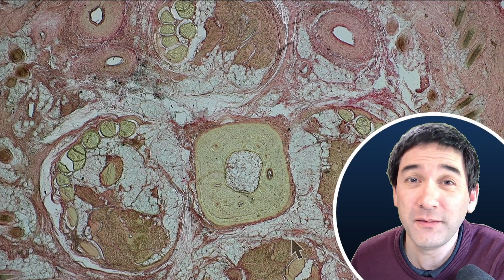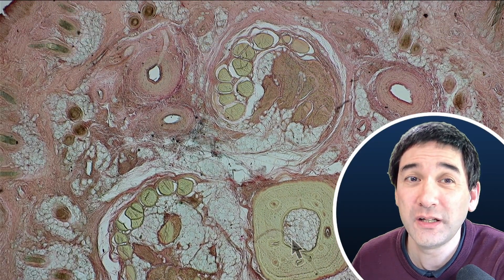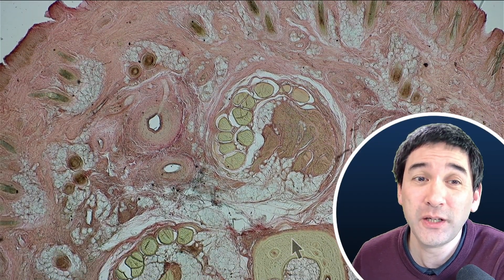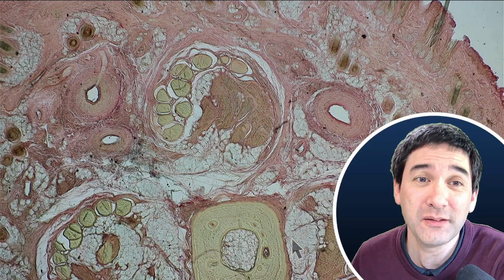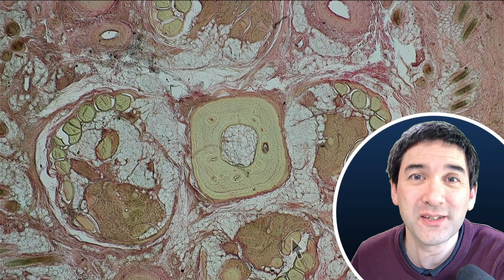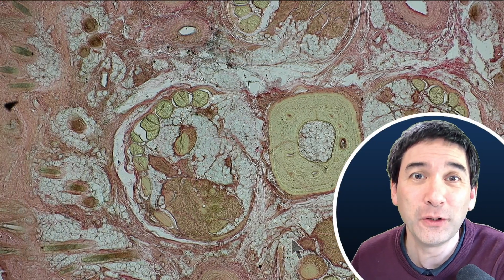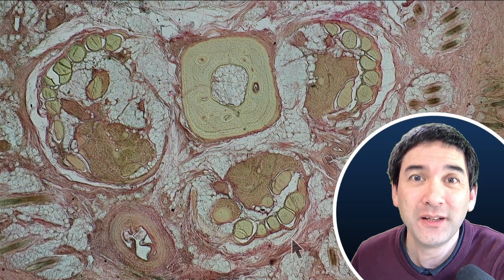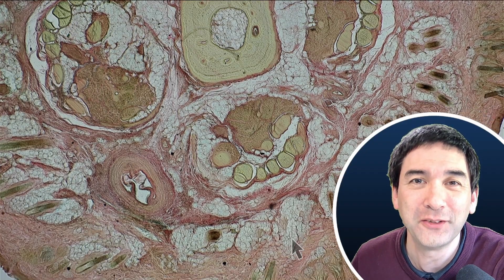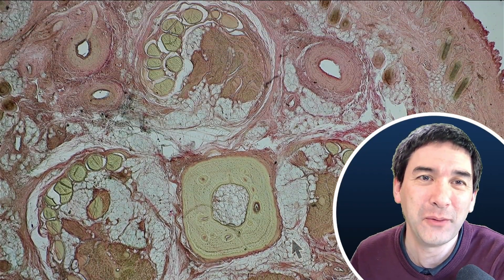However, it is a very high quality slide, which you can see already — it's a very flat cross-section. When I looked at it for the first time after I ordered it, I said wow, cool. Look at this: you can see the muscles, you can see the tendons, the bones, you can even see the hair follicles, adipose tissue, the arteries. A lot of terms I'm throwing around right now, but I'm just going to show you all of them one by one.